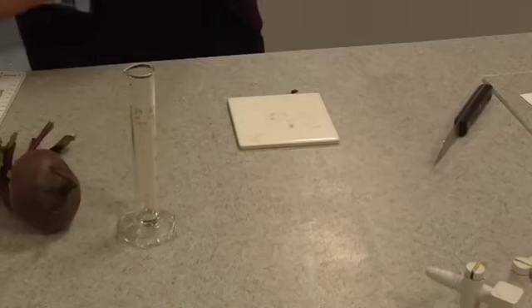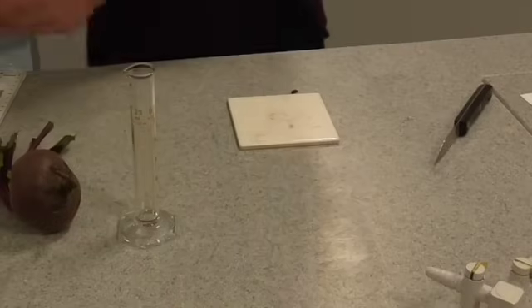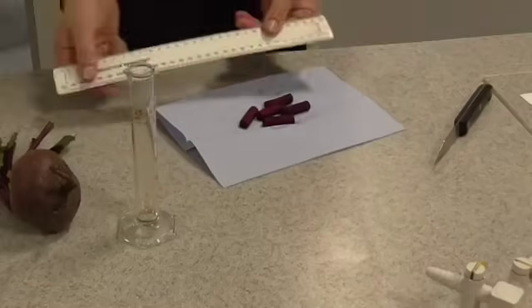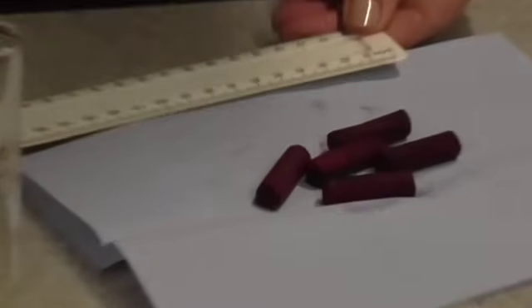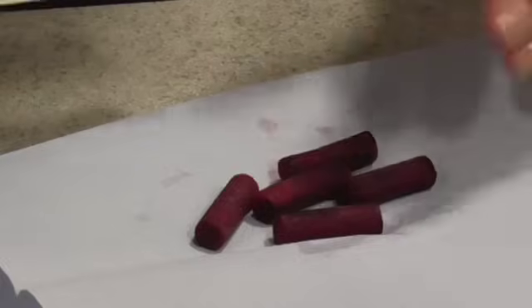The next thing you need to do is blot those dry, and get yourself a ruler and a scalpel or some kind of blade. You need to cut yourself five little chips of beetroot tissue and make them all the same length — as similar as possible — so they've got the same surface area.